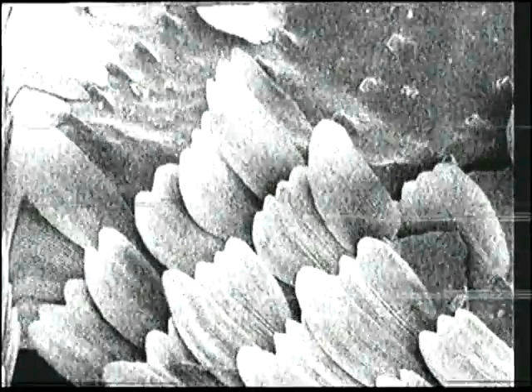And there are actually struts within those struts, but I only saw those in a much better electron microscope than these. But you can see that at the highest magnification, those are pretty darn small structures. And that's the noisy part. So really a lot of structure inside of butterfly wings.